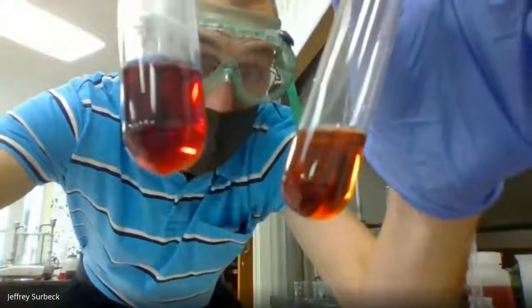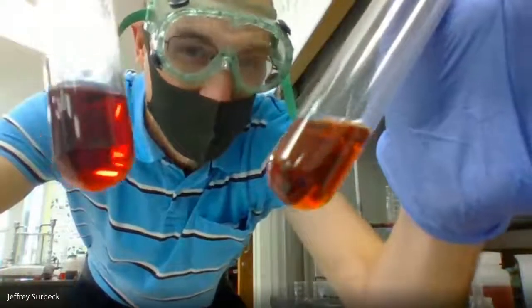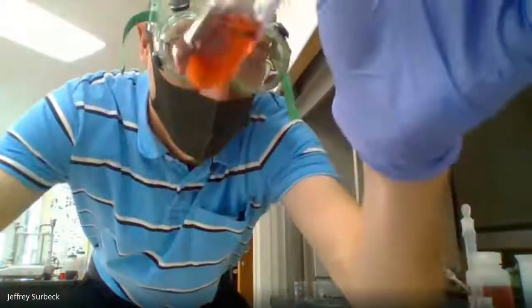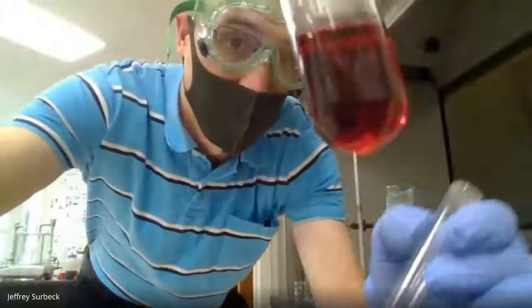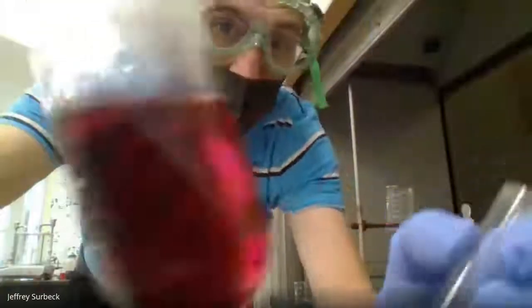This one has this red purple, whereas the cool cobalt chloride kind of has that red orange color. So again, note the color difference. The one right here, that is the cool cobalt chloride. The one that I have with the test tube holder, that is the heated. So you can definitely tell the color difference as we bring it up to the camera.